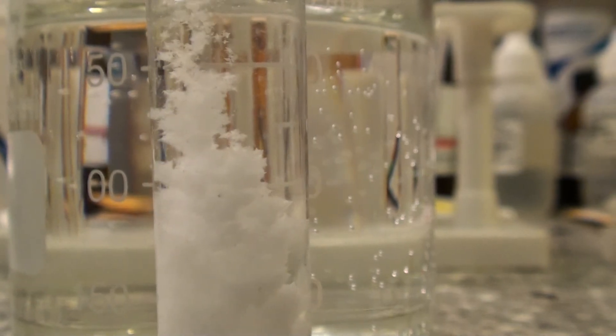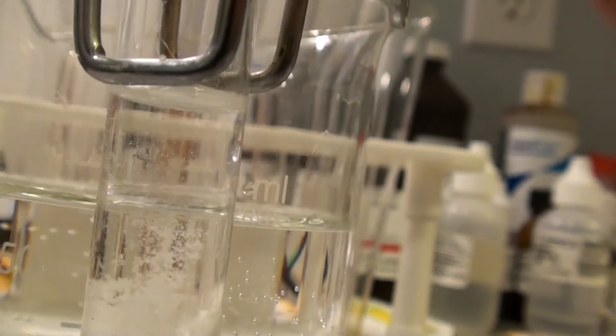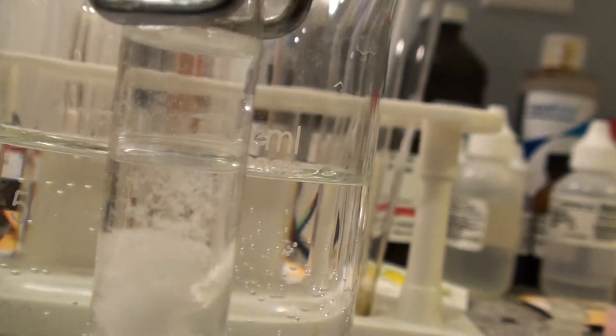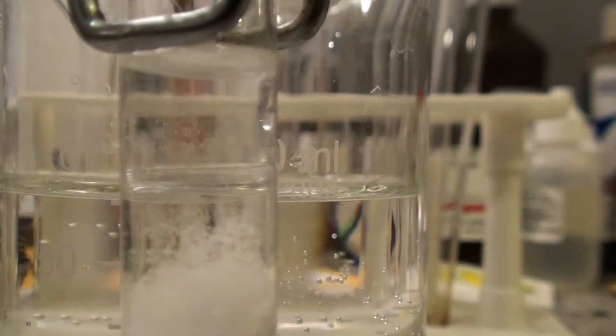By the way, this is real time. It's actually crystallizing this quickly. Surprisingly. Some toy stores, you can buy crystal growing kits which grow crystals, but it takes weeks. This is just kind of like a fast version of that.